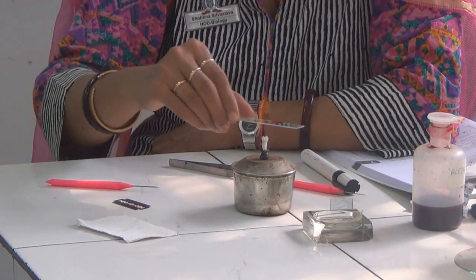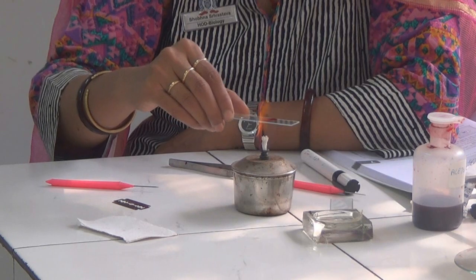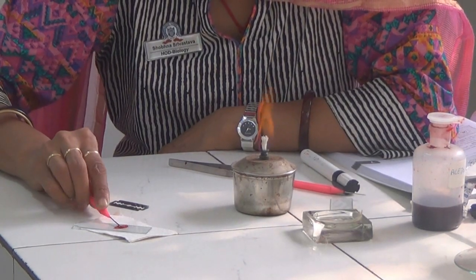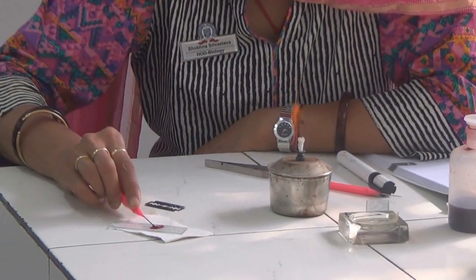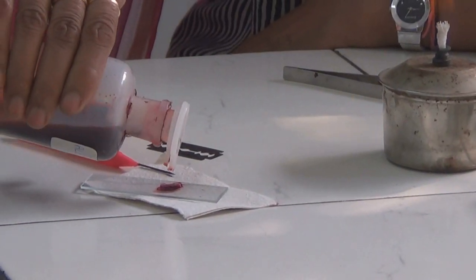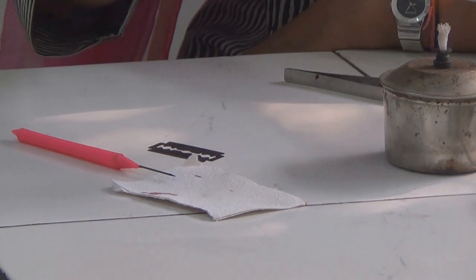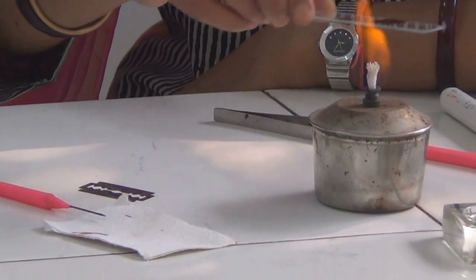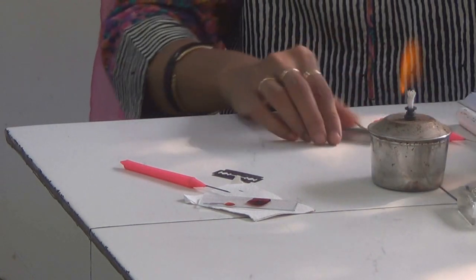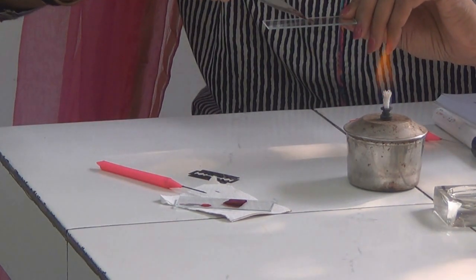Since the plant cell material contains a cell wall, the stain needs to penetrate through the cell wall to the nucleus so we can observe the stages of mitosis. We are going to cut the material into smaller pieces so that it is easier for the stain to penetrate. Add some more stain and heat it once again. Do not overheat it and do not heat it continuously on the flame, otherwise the material will get burnt. You can then transfer the material from the slide onto another slide.